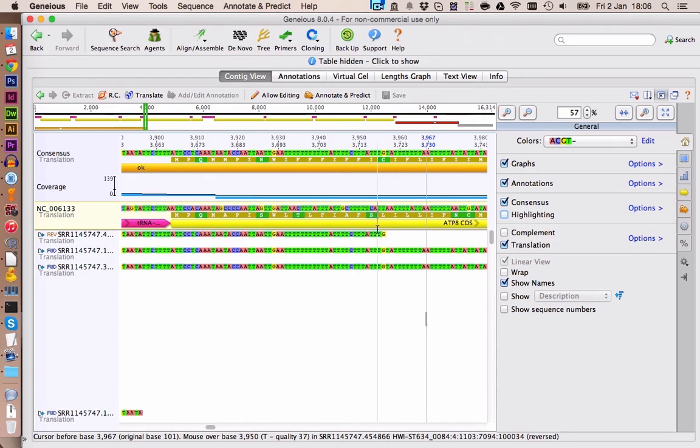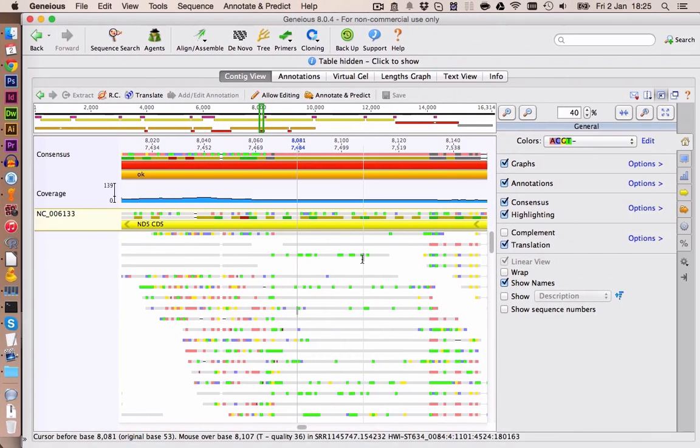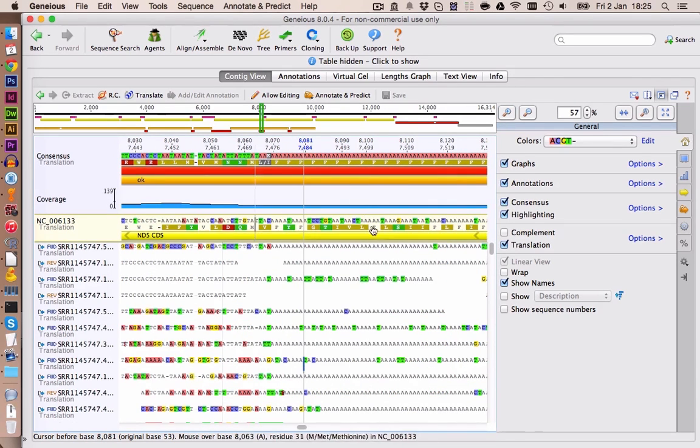However, if we just take a look at the color itself, the amino acids which are used are kind of similar. So it's a difficult decision if we should exclude it or not. I would say we add an annotation which is saying unsecure. I found this other spot where it has a lot of A's in the sequence, so this is also not really possible. So we're going to delete those sequences as well. Overall, the first view of the data doesn't look too good, but we will see what we can make out of it. So let's delete those sequences here as well.